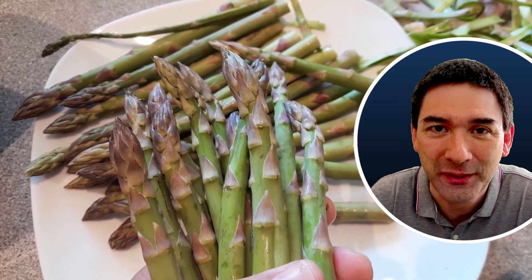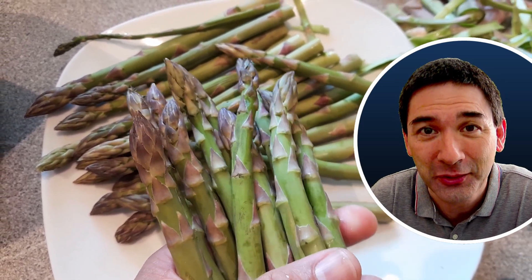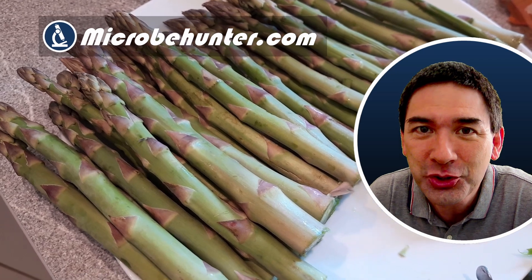Today I'm going to put some asparagus under the microscope and we're going to look at the cellular structure. Hello and welcome, Microbe Hunter here. Of all possible vegetables, why exactly asparagus?